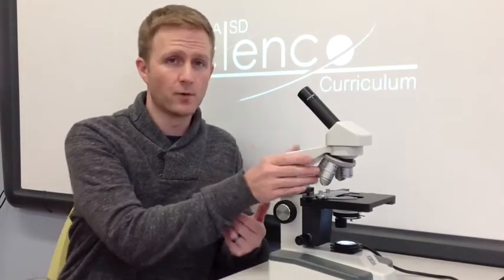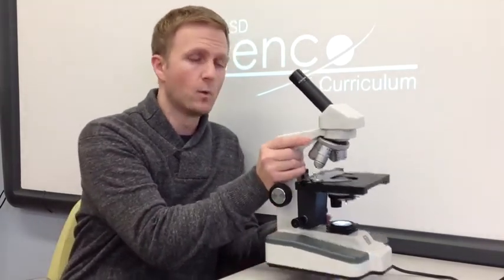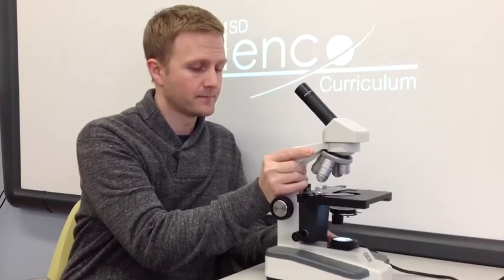Before we go over the parts of a microscope and how to use it, there are two issues I want to address first. One, in case you need to move the microscope, make sure you use both hands, one grasping the arm, one picking up at the base. The other item, the slides that we're using today are made of glass and can break. So please be careful with these, and in case your slide does break, as always, make sure you contact the teacher first. Do not try to clean it up on your own.